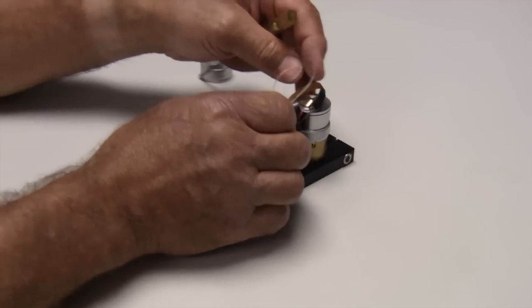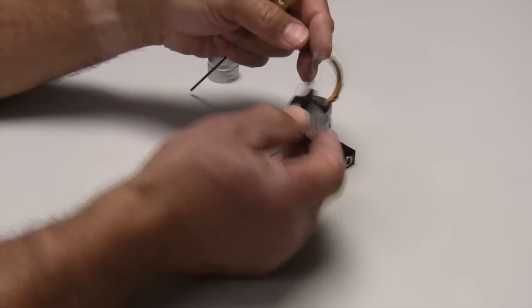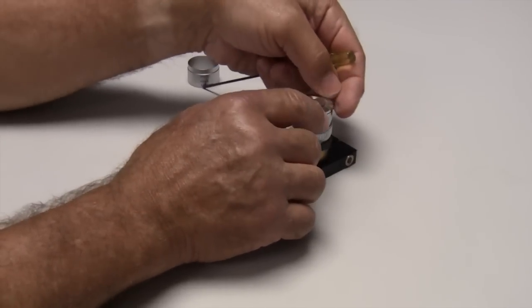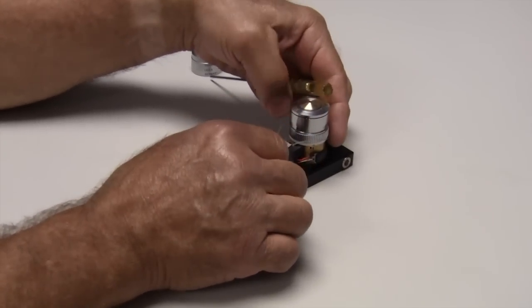You simply place the objective heater, in this case you'll notice it's upside down, on top of the objective, slide the heater band to the bottom, and slide the support band down also.